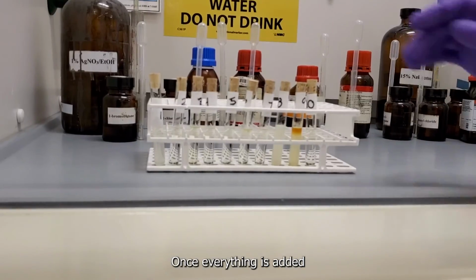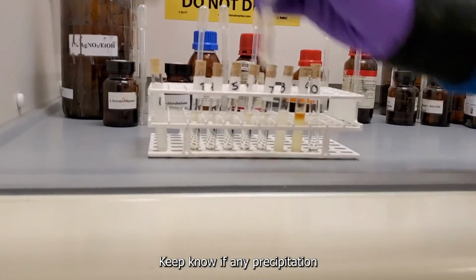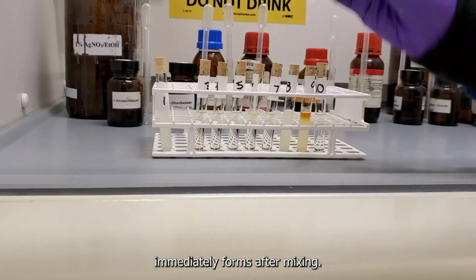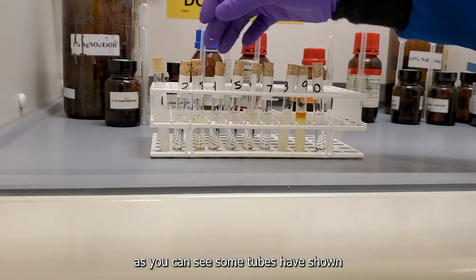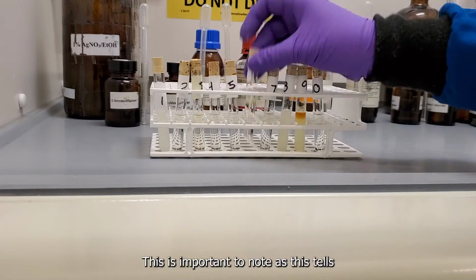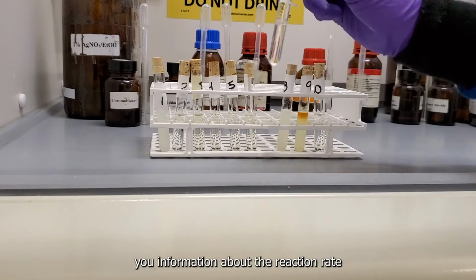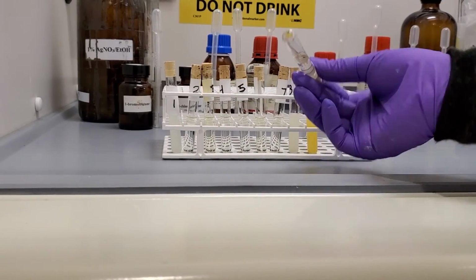Once everything is added, ensure to shake the tubes properly to ensure proper mixing. Keep note if any precipitation immediately forms after mixing, and note any color changes. As you can see, some tubes have shown precipitation already without any mixing. This is important to note, as this tells you information about the reaction rate and the kinetics of the reaction.